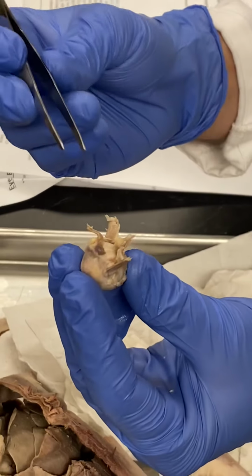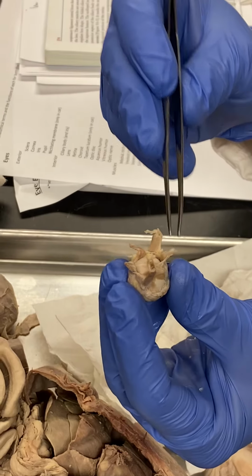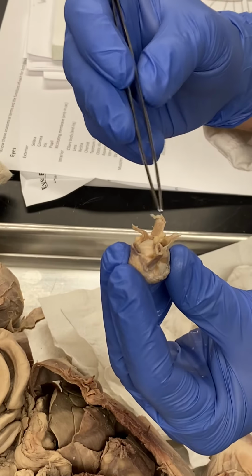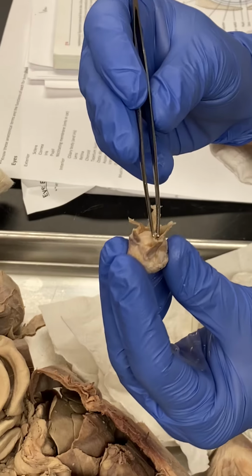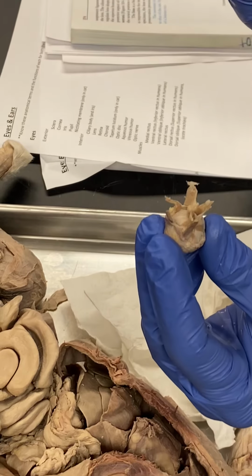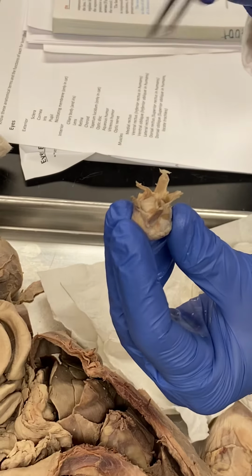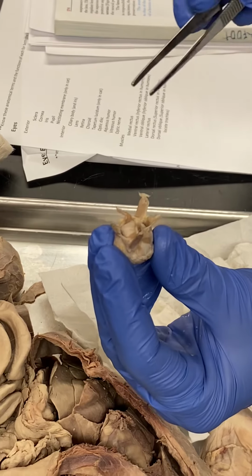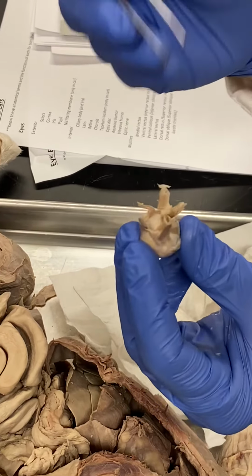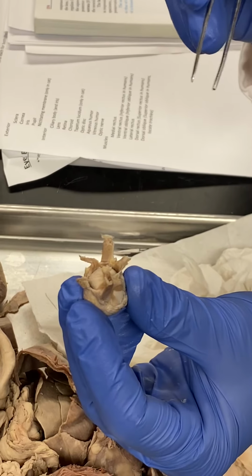So locate that, and make sure you don't confuse it with a muscle, okay? Once you orient to this, you have two muscles down here and two muscles over here, all right? And then single muscles on either side. Hopefully you would know that those single muscles on either side are either the lateral or medial muscles. So first orient in that way. Now your question is, is it this way or is it this way? There are also subtle differences between the dorsal muscles and the ventral muscles.